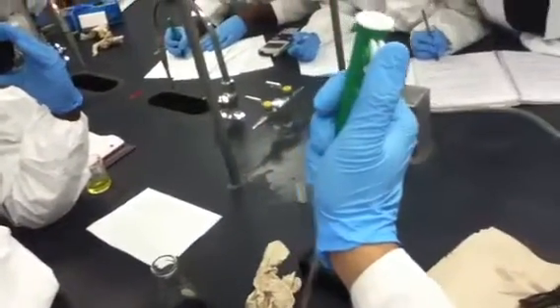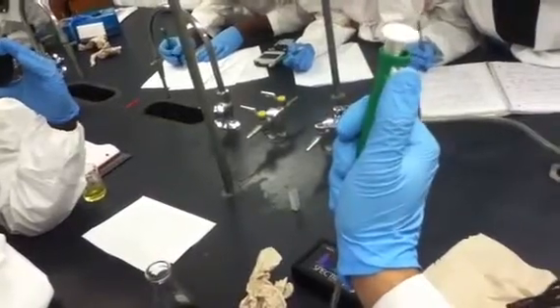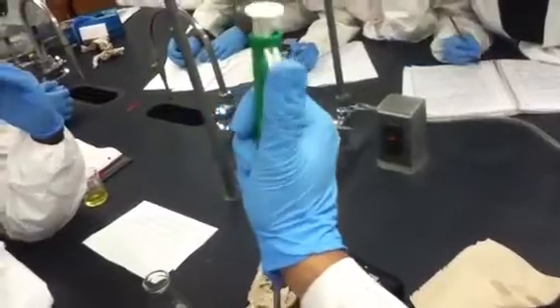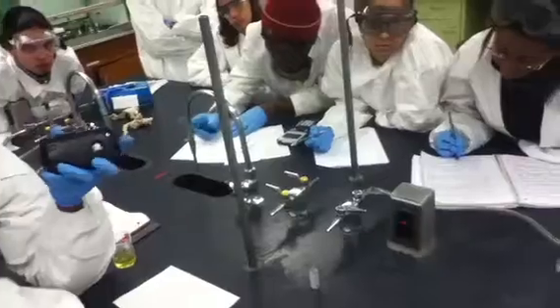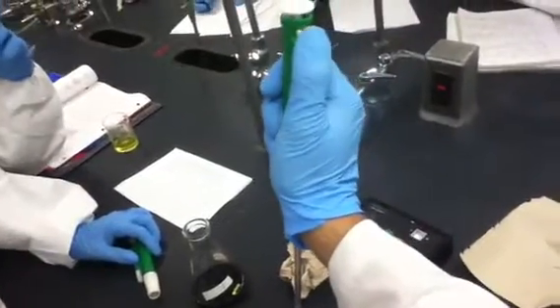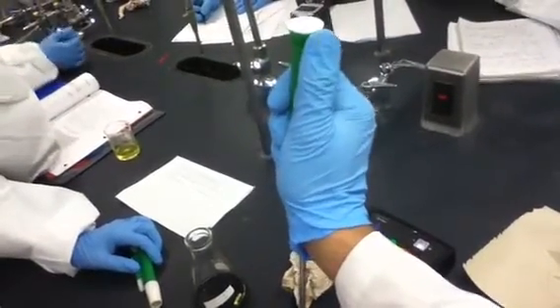Diluted, it doesn't work? Use this one. It's the same. So you want to make sure they're mixed well in this case. Okay, you mix them then. So we're mixing it now. It's like you're cooking something, right? Okay, so let's put it in here, back again in this case, and see what it gives us.